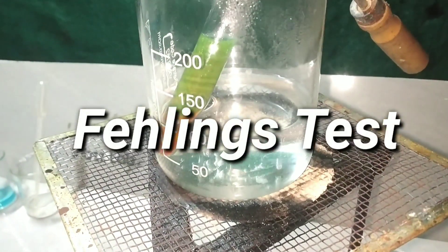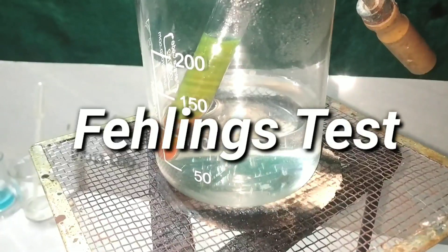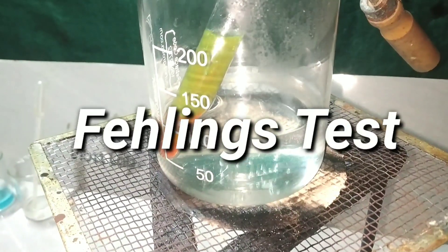Hello friends, in this video we will make the Fehling's reagent and do the Fehling's test for reducing sugars.